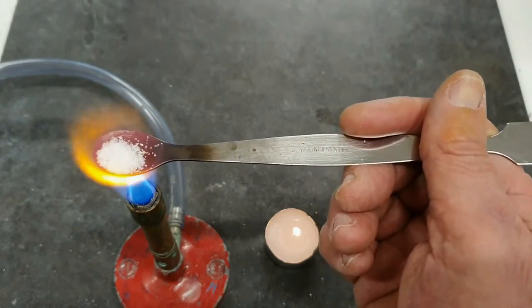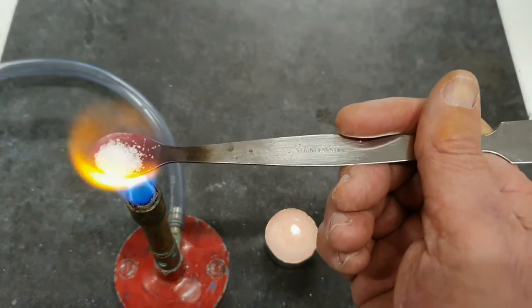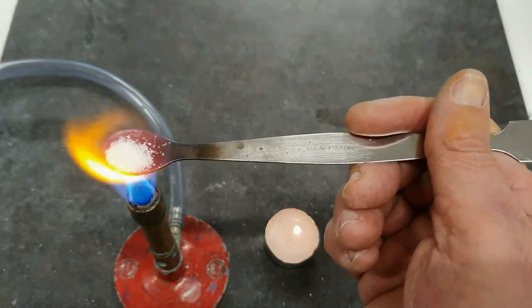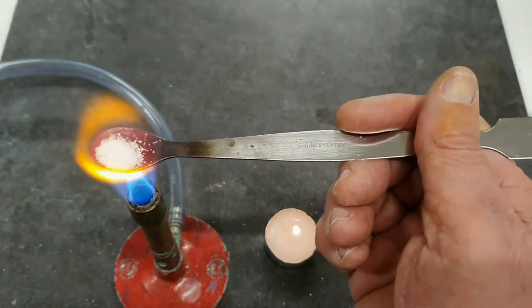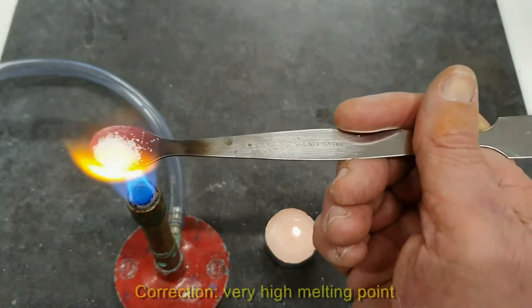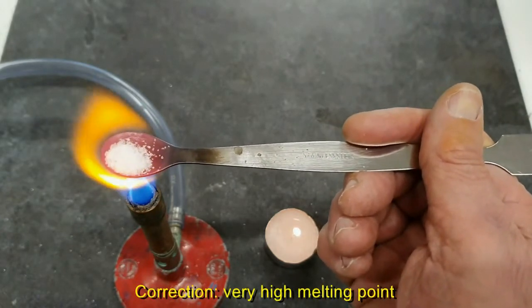Again, now it's very, very close to being red hot. So it didn't melt in the candle flame, it didn't melt in the Bunsen flame, so I'm going to say high melting point.